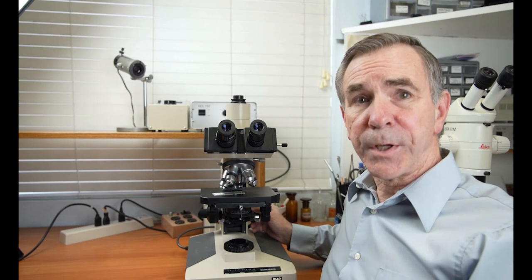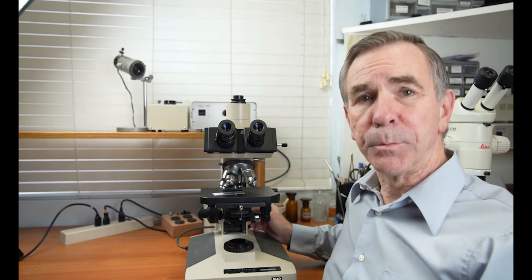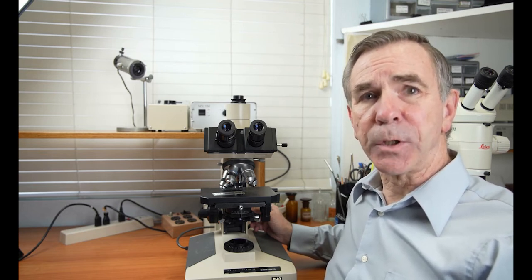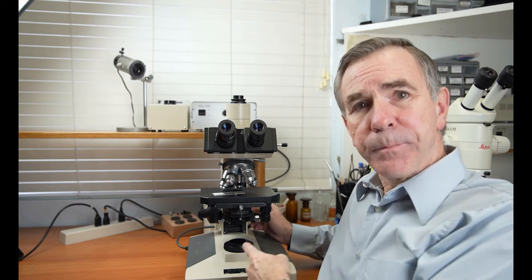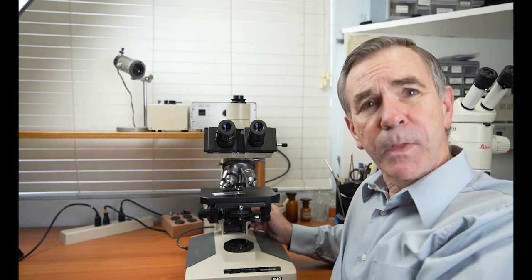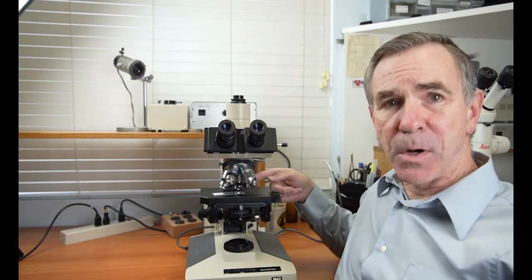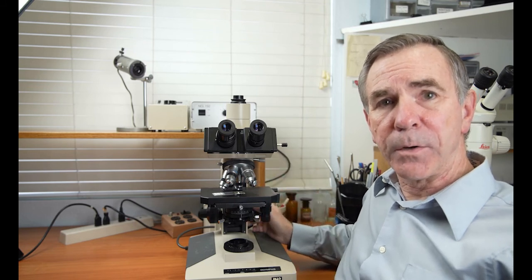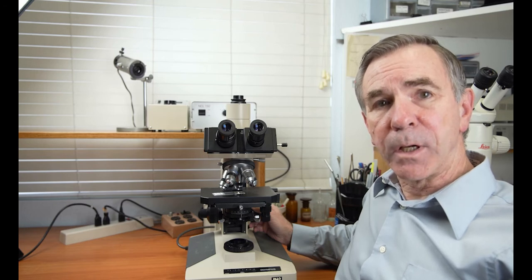We'll be more specific in another webinar on the details of setting up Kohler illumination. But now, I'm going to give you some highlights on setting up Kohler illumination. Assume the following. Your microscope light is on. The substage and field diaphragms are each about half open. The 10 times objective is in the optic axis of the microscope. You have a sample on a slide on the stage of the microscope under the objective. And now you begin by focusing on your sample.